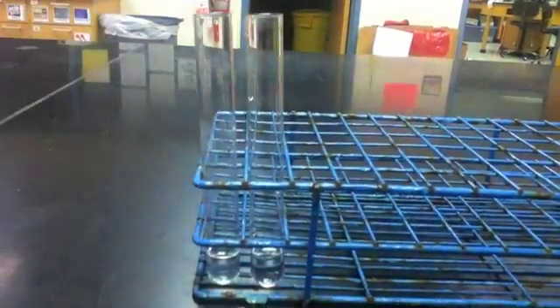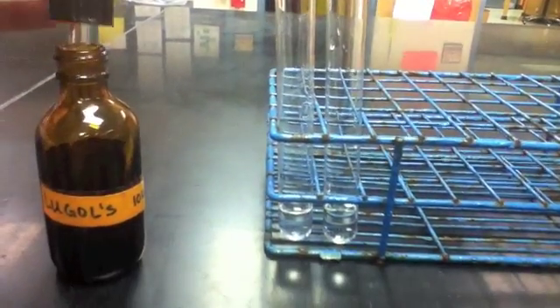To detect the presence of starch, I'll be using a reagent called Lugol's iodine. In the presence of starch, iodine will turn the solution a bluish-black color and will precipitate on the sides of the tube.